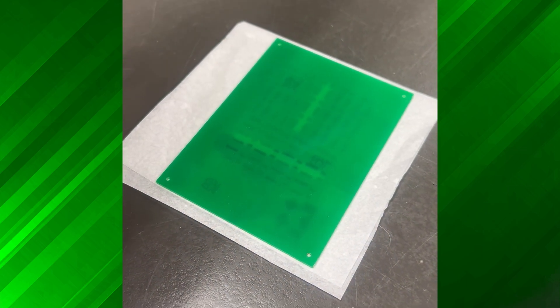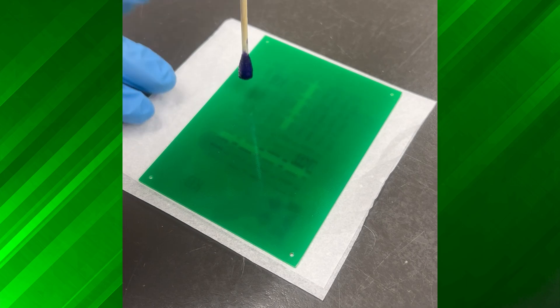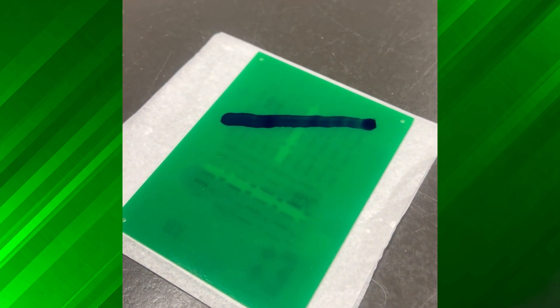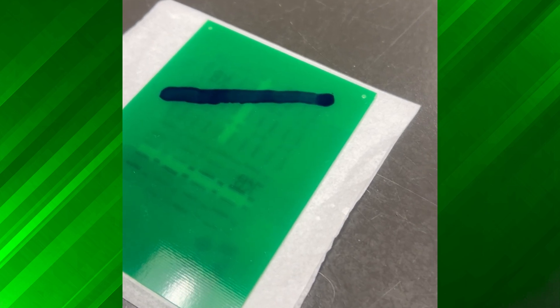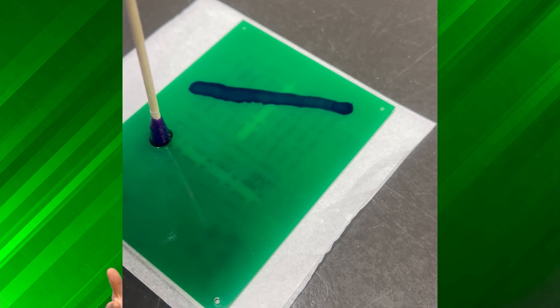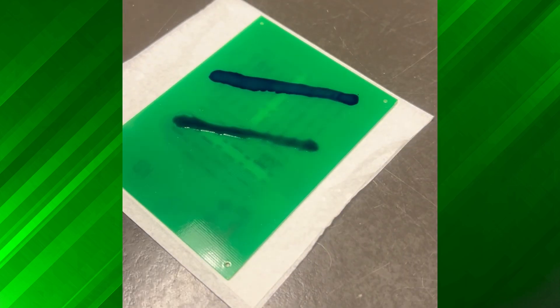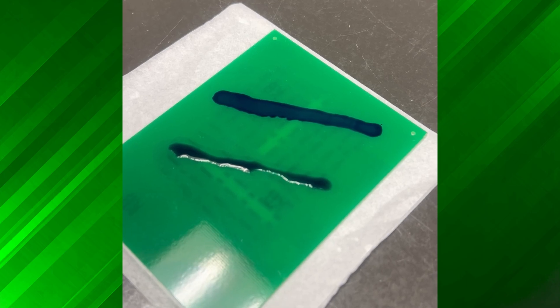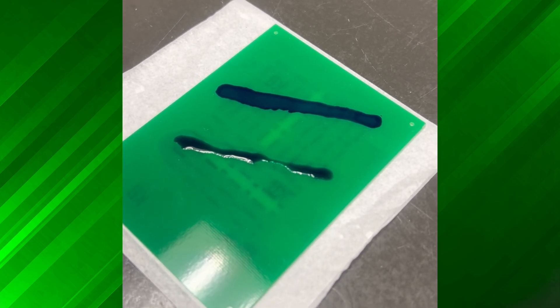In a dyne test, a swab is soaked with a low dyne fluid and dragged across the surface of the part being tested. Watch the line to see if it beads up or wets out. If it wets out, then you repeat the same test with the next dyne fluid in your kit, until you reach a point where the fluid no longer wets out. The dyne value of that fluid will be close to the surface energy of your part. If you know what this value should be for a clean part, you can skip the whole lineup and just test the one fluid. If it wets out, you're clean. If not, the part's still dirty.